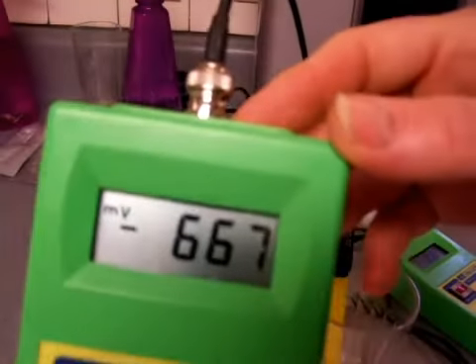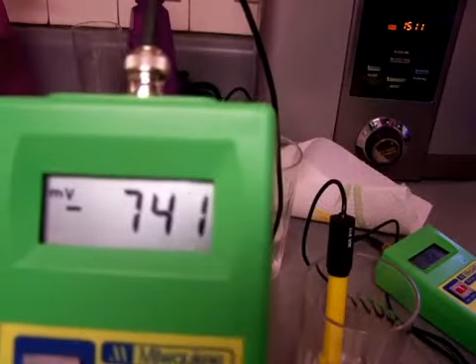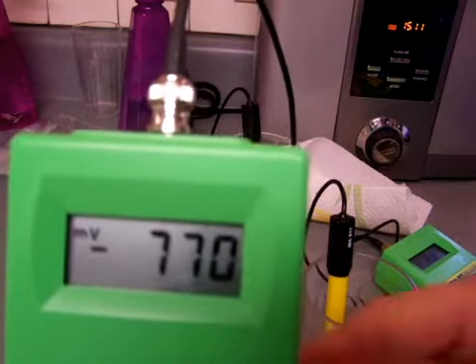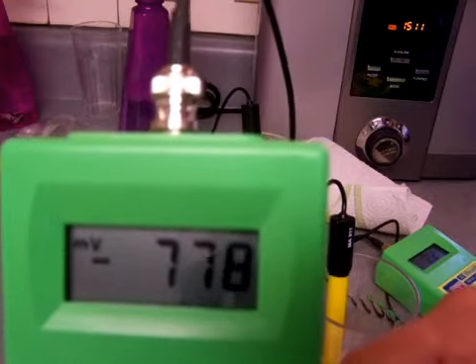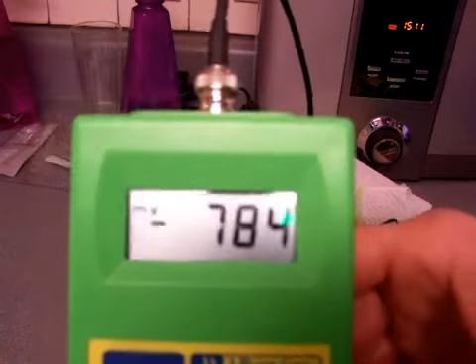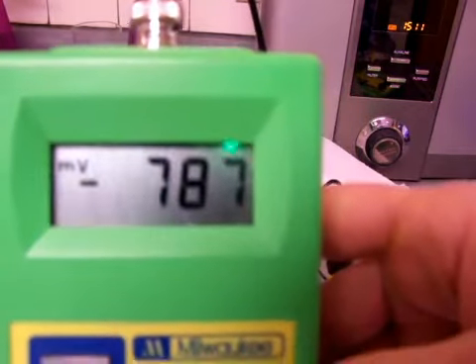Well, actually, that is getting better. It's a negative 600, negative 700 something. So, yeah, I'm not really used to cleaning it so quickly. Usually I have to do what I just demonstrated twice, at least, to get it clean. But this particular time, it was clean to begin with, and last night it was too clean to demonstrate how to clean, so I had to soak it in the ionized water overnight so as to dirty it up, so as to be able to show you what the results of cleaning the ORP meter are.